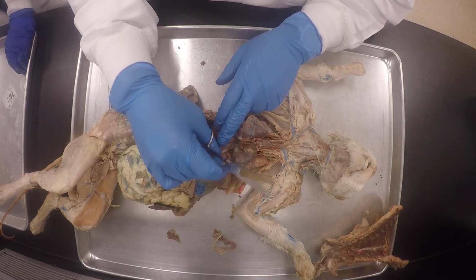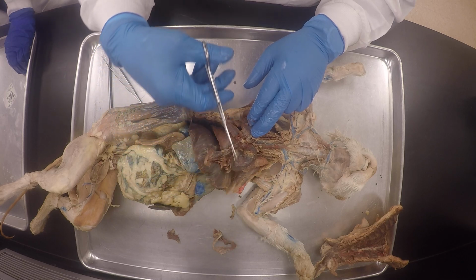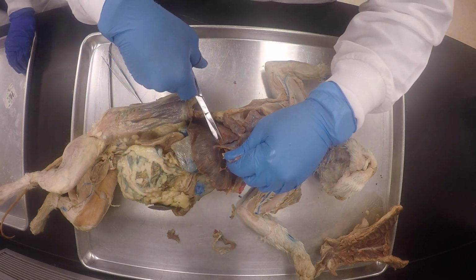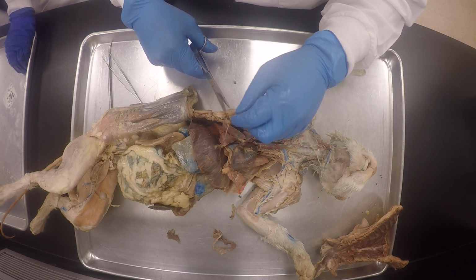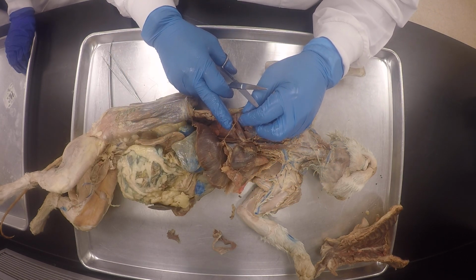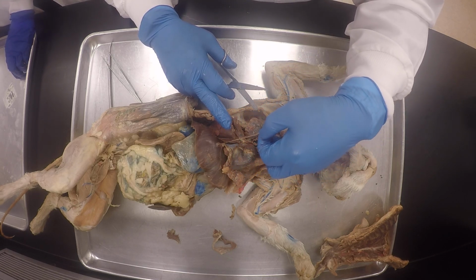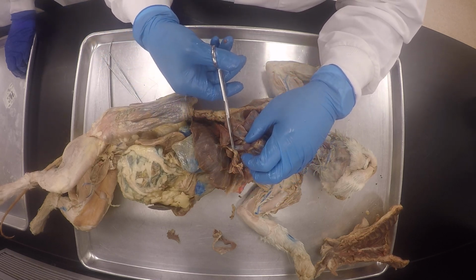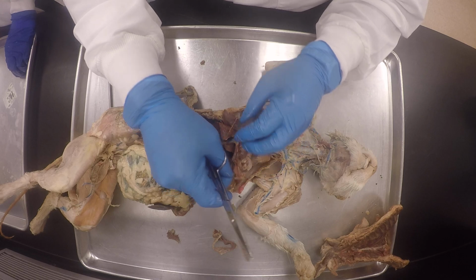And then you could see the phrenic nerve. You see the phrenic nerve going to the diaphragm. So there's the phrenic nerve. You see it's right here on the diaphragm. It's kind of tough, isn't it? It's a stringy nerve. This is the phrenic nerve, for sure. Do you see how it's attached to the diaphragm? It runs along the inferior vena cava, so I had to pry it off of there.